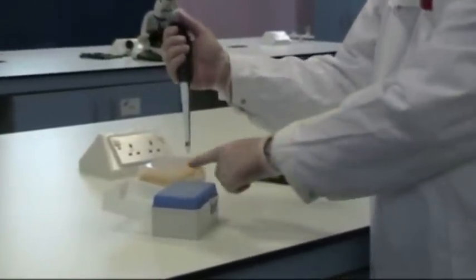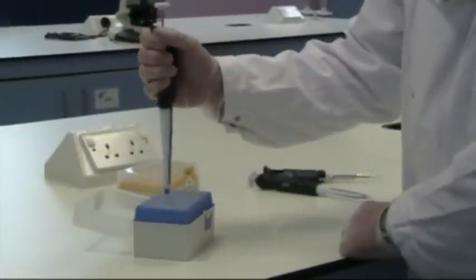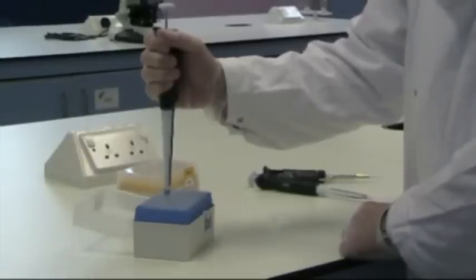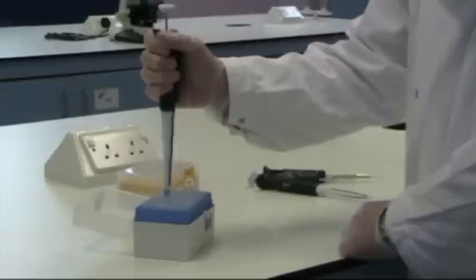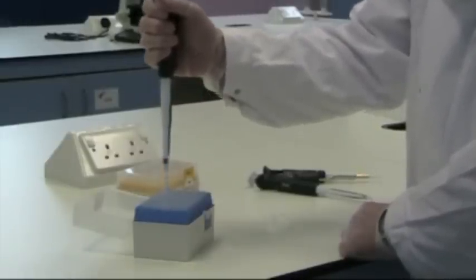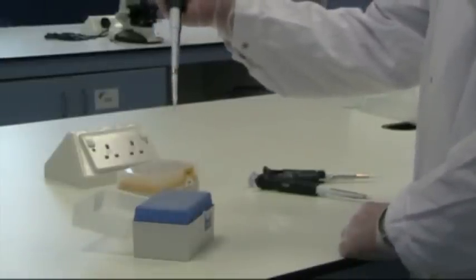The first thing we need to do is attach a pipette tip to the end. To do this, you bring it down and very gently tap it in a vertical manner. Don't use excessive force, and don't use any side-to-side lateral movement, as this can damage the barrel. You should see that the pipette can withdraw itself from the box without sticking to the side.